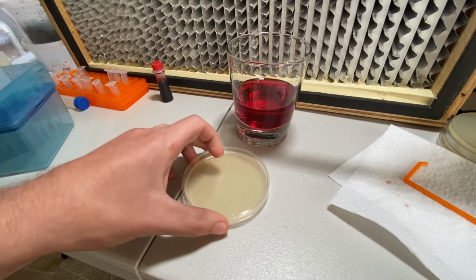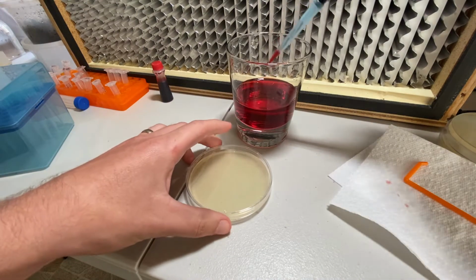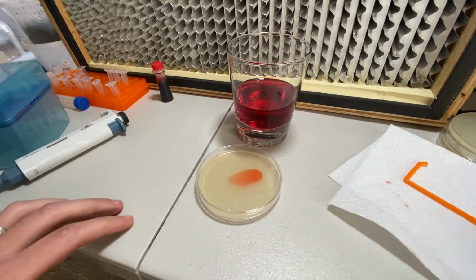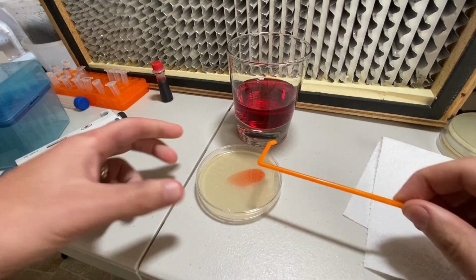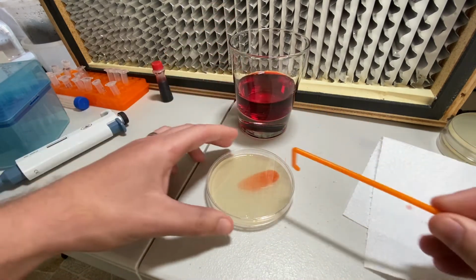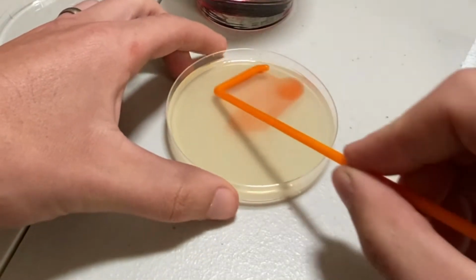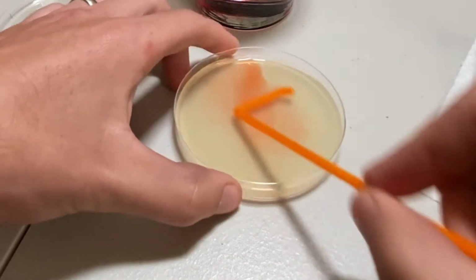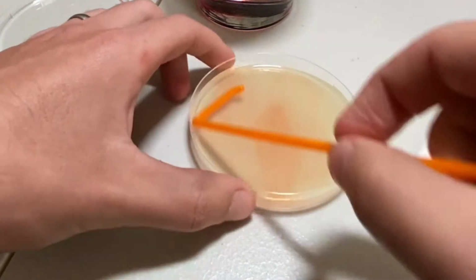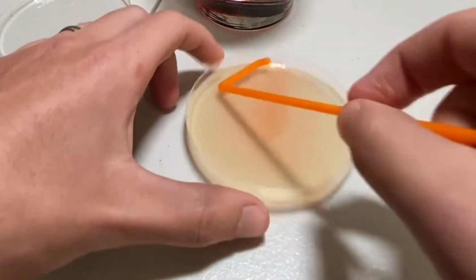And this is a regular LB plate that's been sitting on my shelf for a little while. What's cool is you can kind of see how my table is kind of uneven. Now, when I watched a couple of videos, this is the way that they said to do the spreading, is to move this back and forth while turning it until it starts to feel kind of dry.